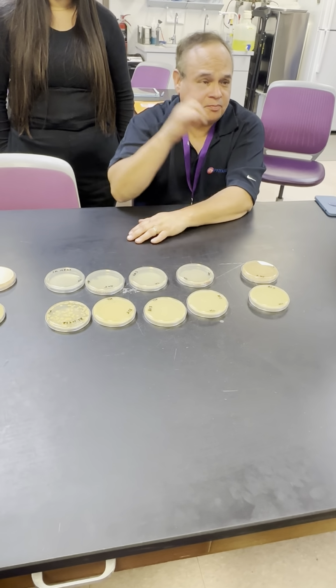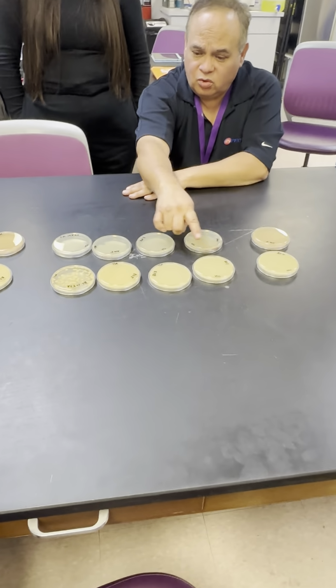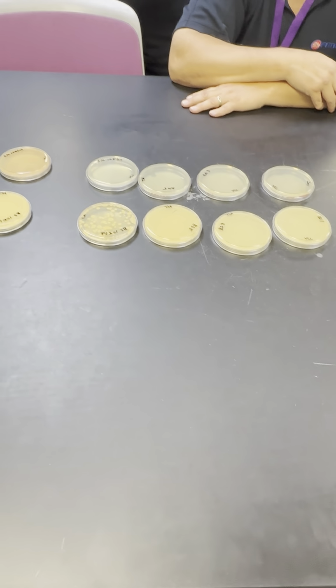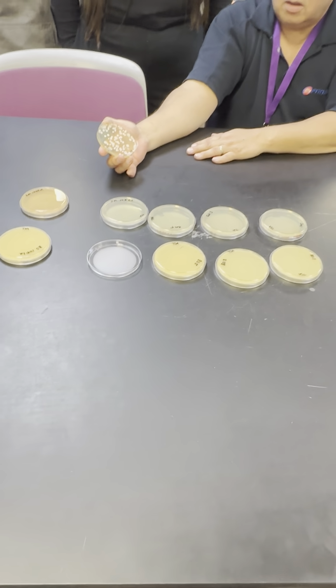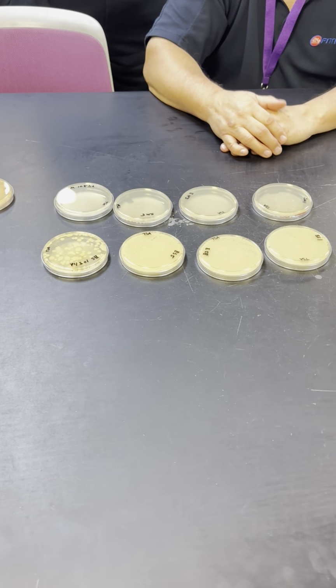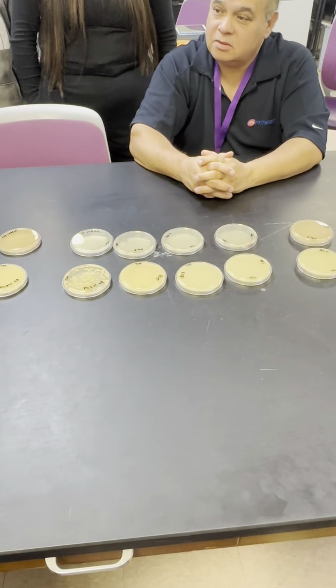But now something very interesting happened, Ruth, with Bacillus subtilis. It grew everywhere. Even at 10 minutes with the lid taken off, there's a lot of the organism growing on here. Can you provide a hypothesis for why that might be? What was the name of the bacteria again? Bacillus subtilis. Now provide a hypothesis.